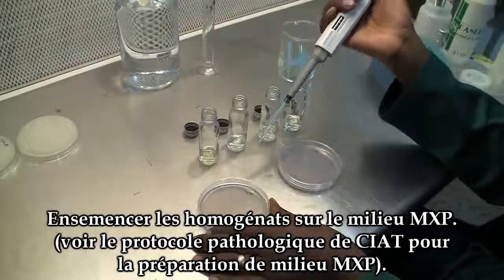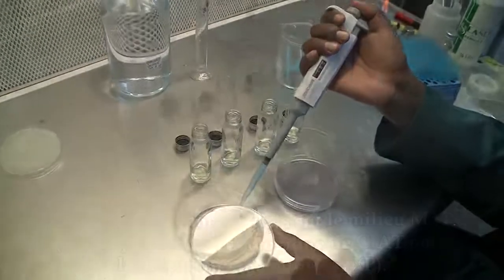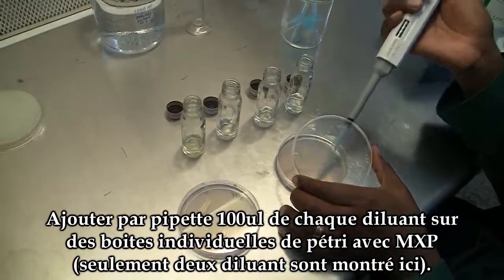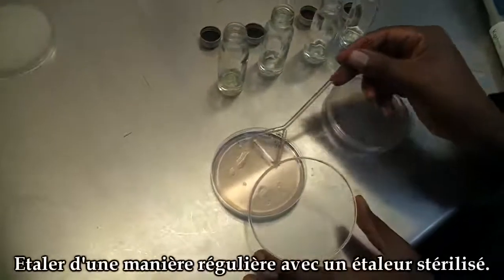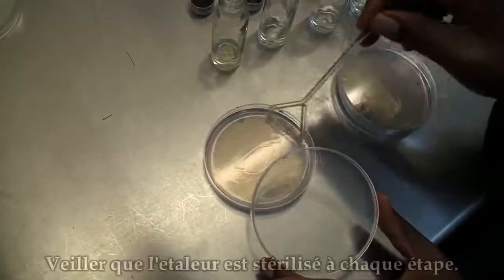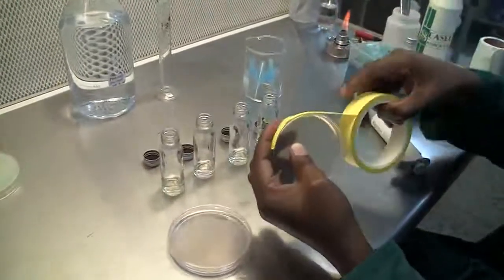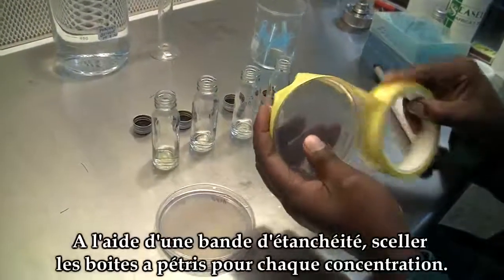The next step will be to plate the homogenates on MXP media. To do this, pipette 100 microliters of each of the dilutions onto a separate MXP plate. Spread evenly using a spreader, ensuring to sterilize the spreader at each stage. Using sealing tape, seal off the petri dishes for each of the concentrations.